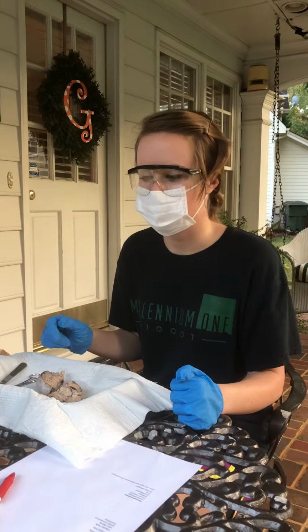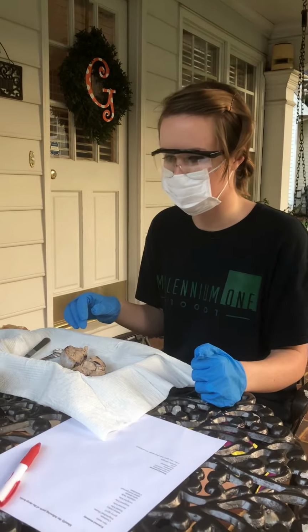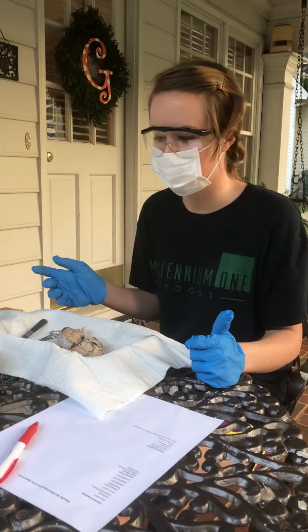Hi, this is Mary Gerald, and I've just finished up dissecting my sheep brain. So this is obviously for the brain dissection lab.